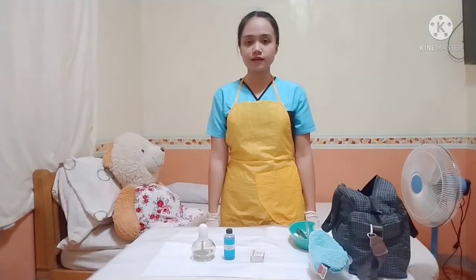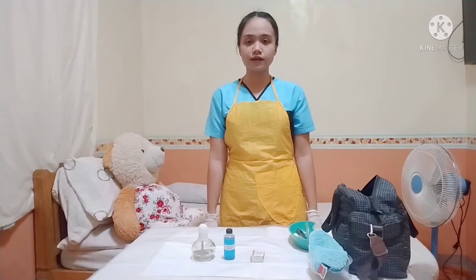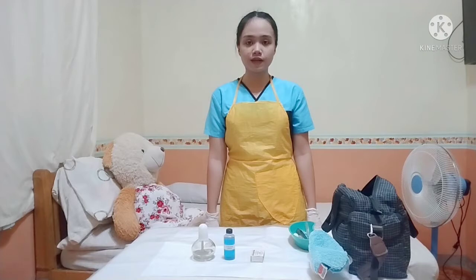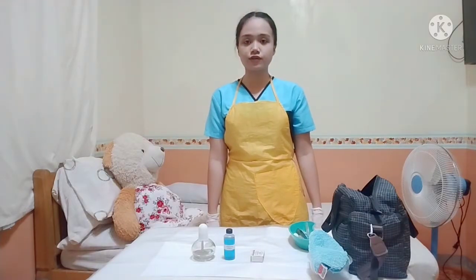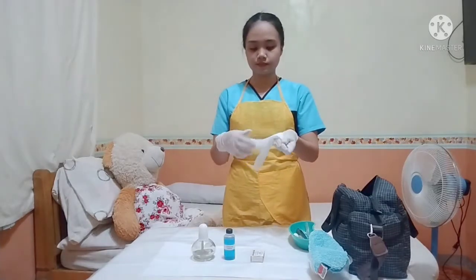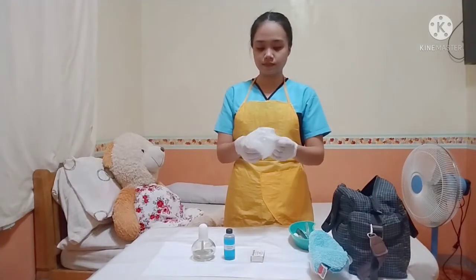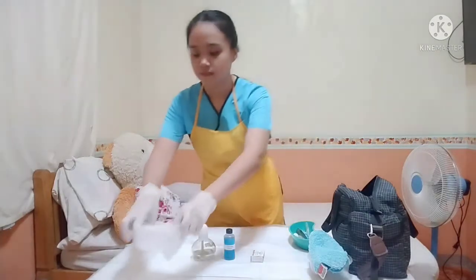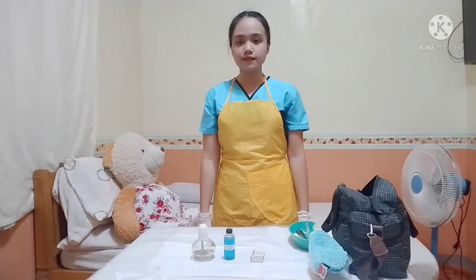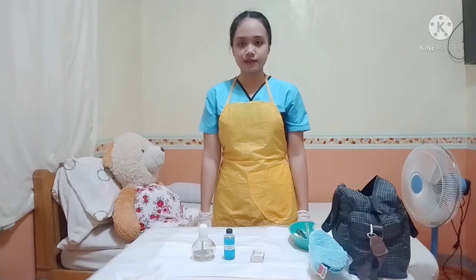And then next is take out the waste receptacle and then place it away from the clean materials or outside the paper and plastic lining because it will contain soiled and contaminated materials, so it should be separated. And then next is light the lamp para po mag-ready for the urine test.